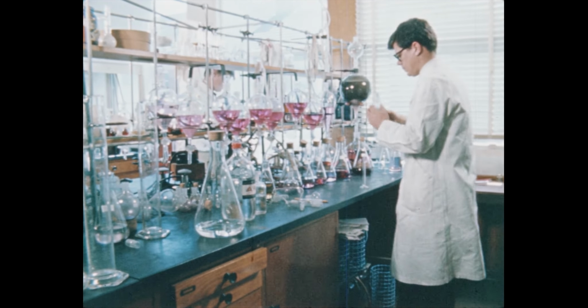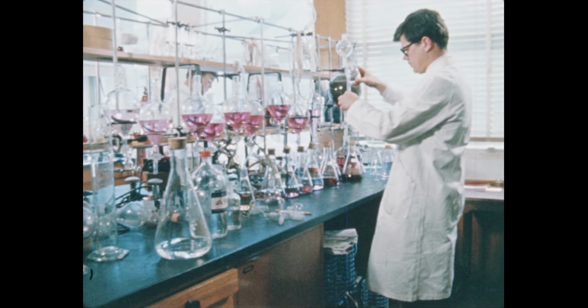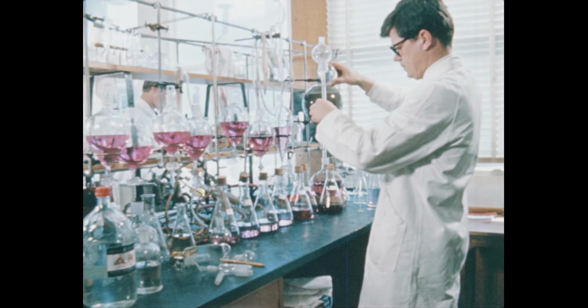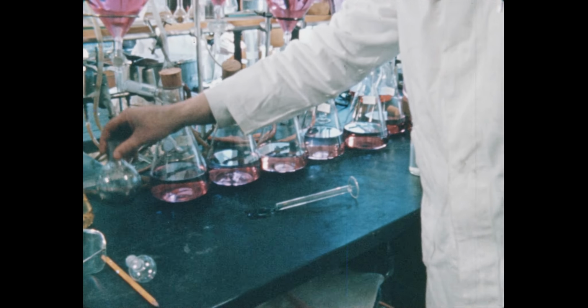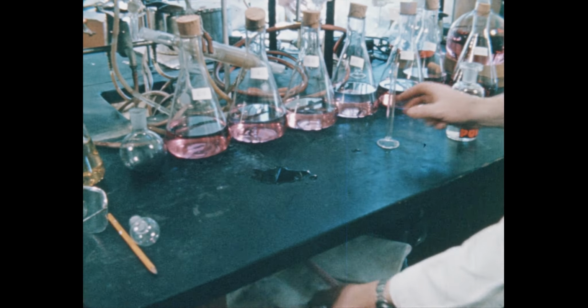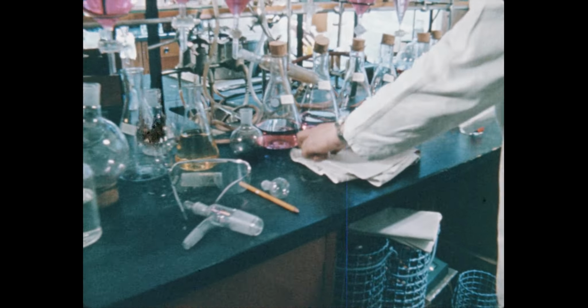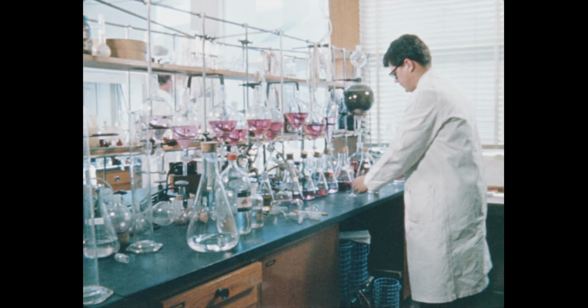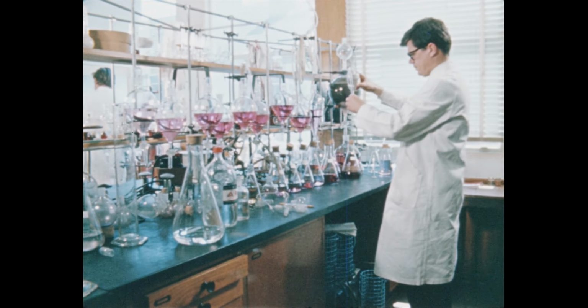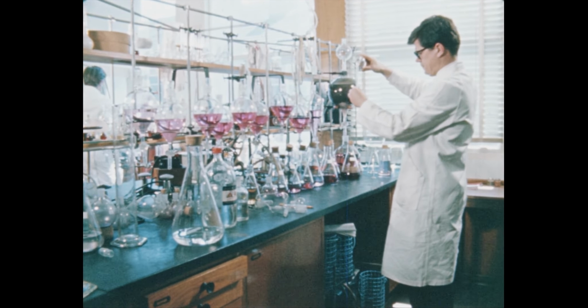How much exposure is dangerous? Well, if the vapor can be smelled, it's there in dangerous quantities. Even 3 cc's allowed to evaporate in a room this size is sufficient to cause damage. Breathing in the vapors several times a day over weeks, months, or years, for there is no time factor, will cause a cumulative effect of a serious nature, even 3 cc's.